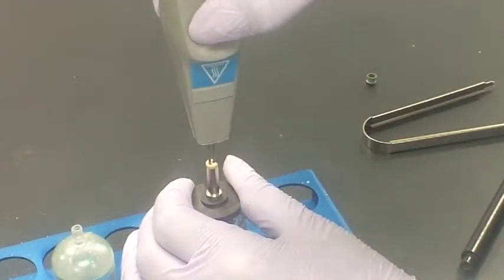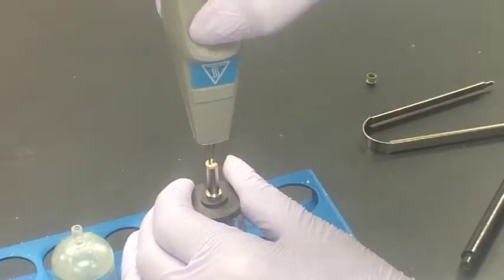Note, always apply the tip of the tube topper vertically to the seal former. Apply gentle pressure when sealing the tube.